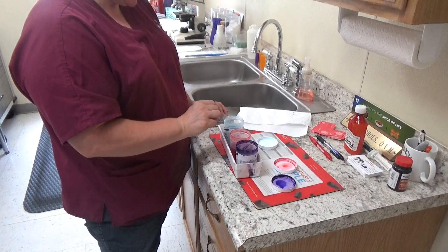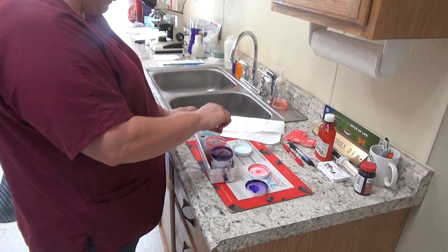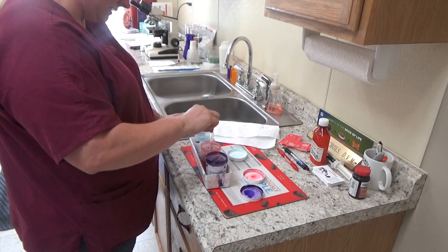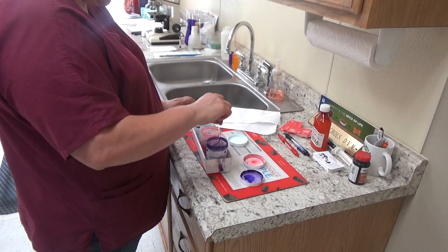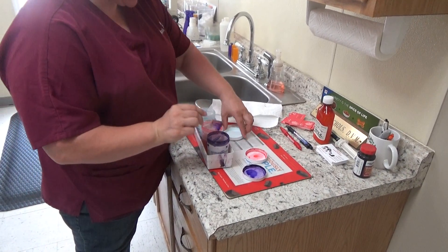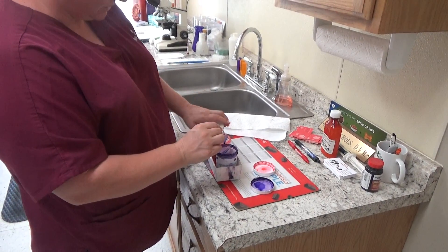I'm going to try to knock off as much excess as I can. Now that I've done that, I'm going to put my lids back on.